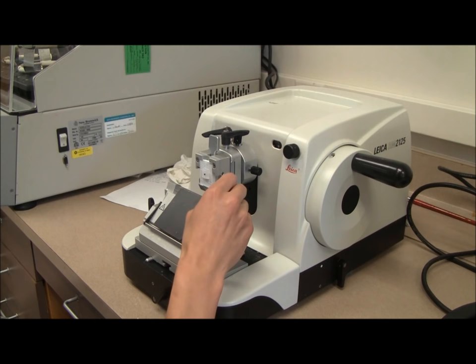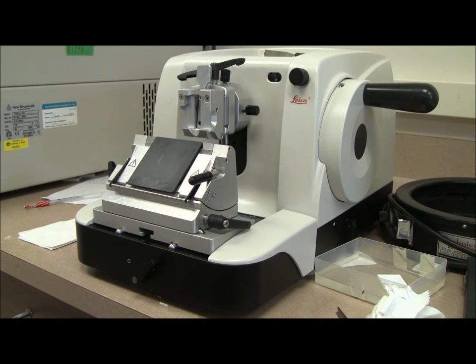The blade can be adjusted or removed using this knob. Typically the blade should be replaced or adjusted before you cut each new tissue block. Make sure to be careful when handling the razor blades.